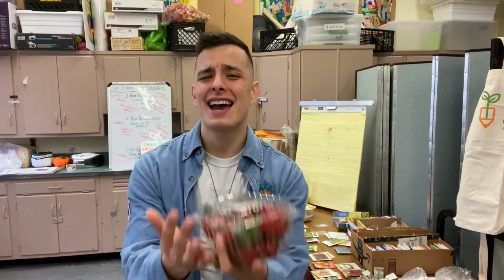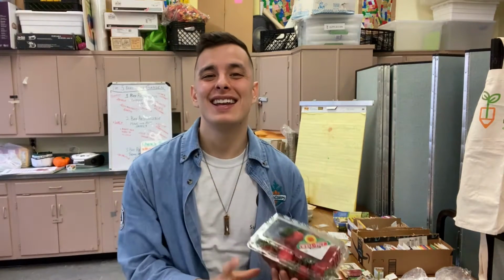Hey everyone, Mr. Pat here, and we have a very fun experiment today. So today, we'll be learning all about variation in plants, and we'll be turning into scientists by extracting DNA from these strawberries. So like always, everyone come gather in, put on your EcoSpaces thinking cap, because we are ready to dive right into these strawberries.